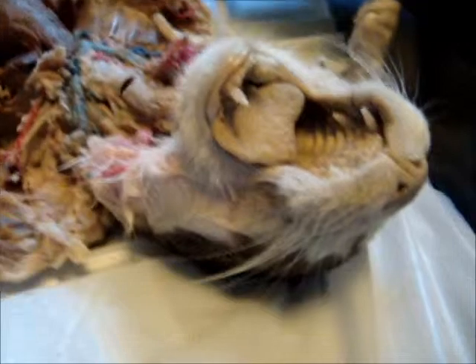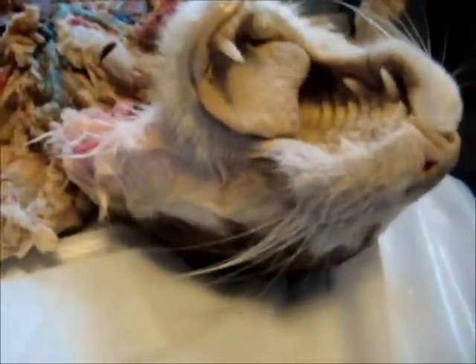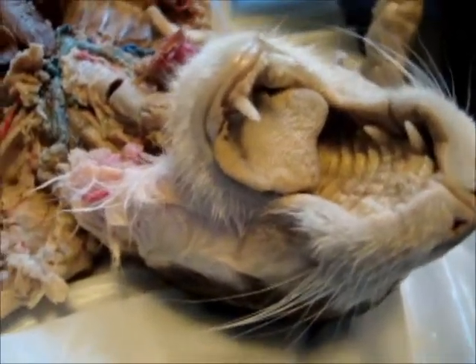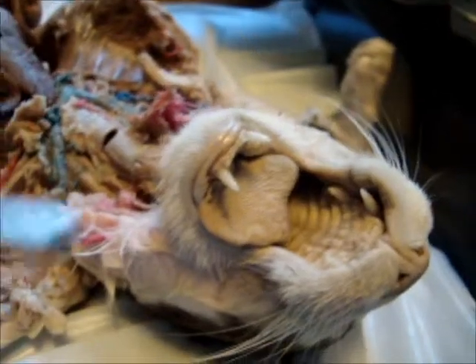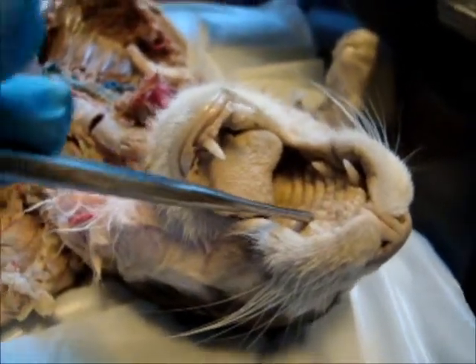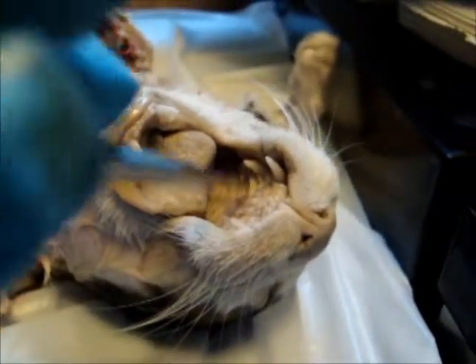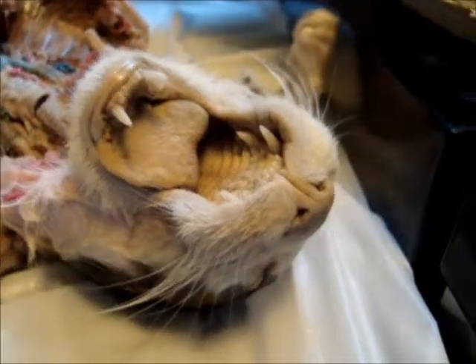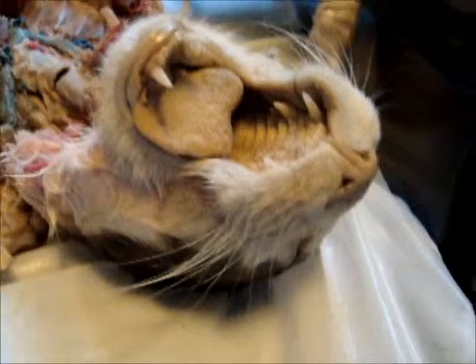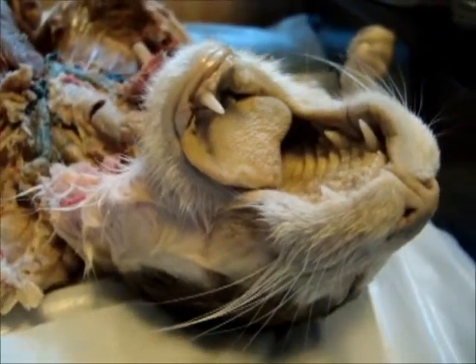I know that humans and cats have very, very different structures. But just before I forget, I wanted to talk about the anatomy of the respiratory system and the head area. Located up top, you'll see that there's a hard palate. Humans have just the same. And then behind that would be the soft palate. Posterior to that, there'll be a very large area which would be called the nasal cavity. Located posterior to the nasal cavity, you'll have the pharynx.